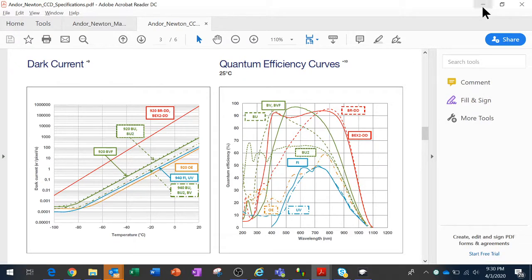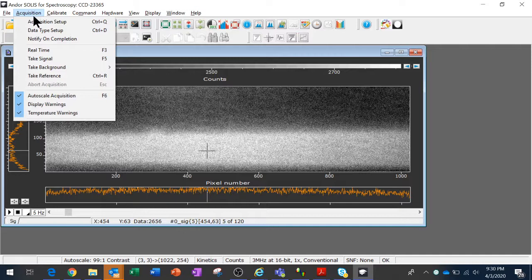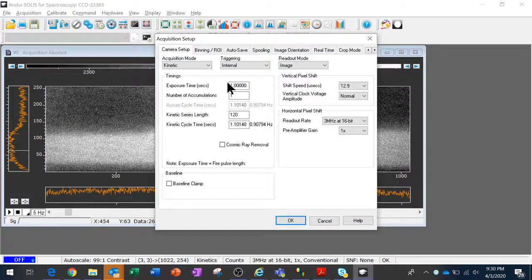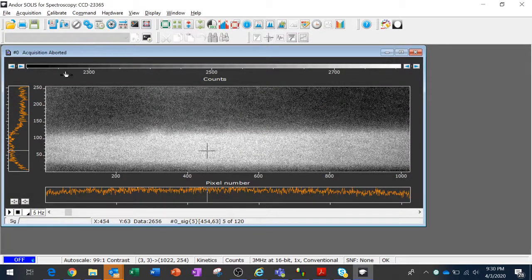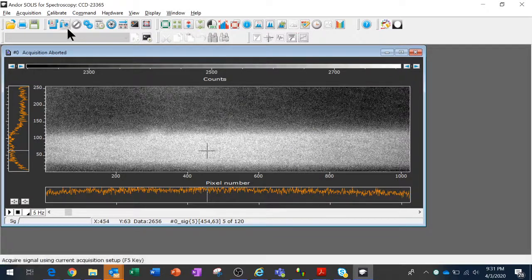So to show you the effect of that cooling visually, I'm going to record a kinetic series, that is to say a movie measurement during the cooling process. So I'm going to set up a kinetic series. I'll go to Acquisition Setup. I've got 1 second so that the numbers are easy to compare to the spec sheet. I'm going to do 1 accumulation. I'm going to run for about 2 minutes because I don't intend to make you wait around that long. So I might not get to the ultimate cooling temperature, but I should get close. And that looks good. I'm going to turn the cooling on, set it to -70, just whatever I can get to in a reasonable amount of time while this video plays. And then I'll start taking measurements.